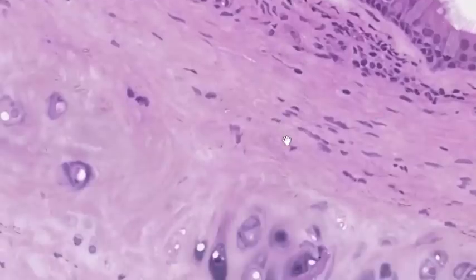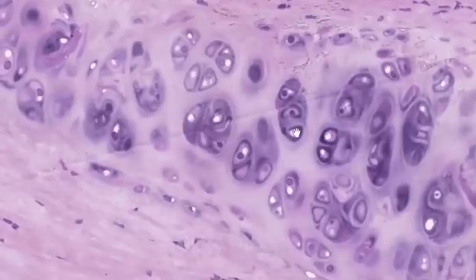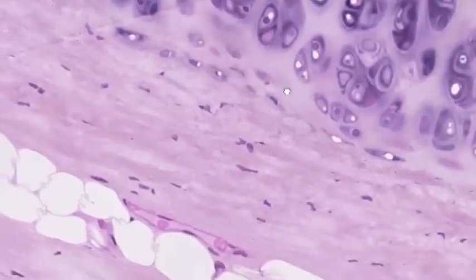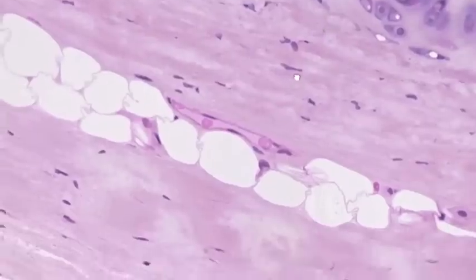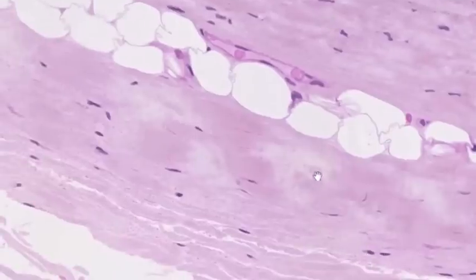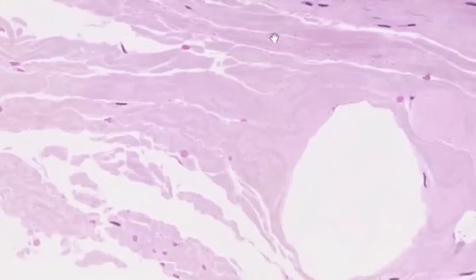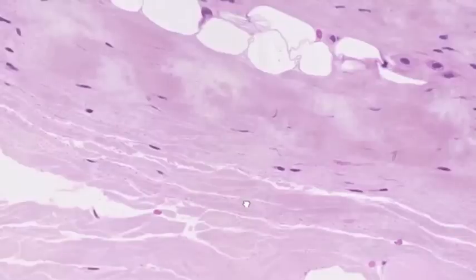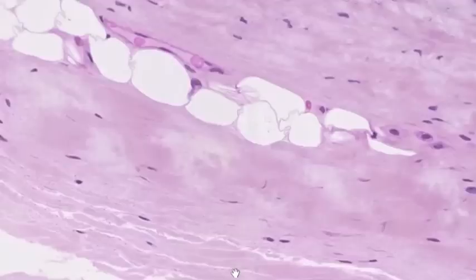As we move outward through the wall of the trachea, we encounter the hallmark feature of the trachea and large bronchi — the hyaline cartilage that reinforces the wall and prevents the lumen from collapsing during inspiration and particularly during expiration. Just outside the hyaline cartilage there is additional connective tissue varying from dense to loose, with some adipose tissue. Posteriorly, this connective tissue blends with the connective tissue covering the anterior part of the esophagus.